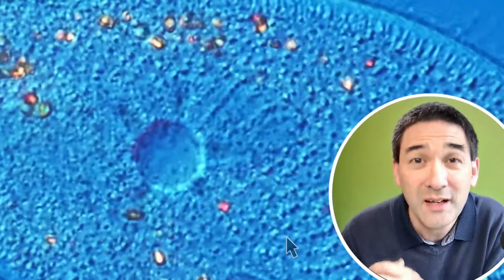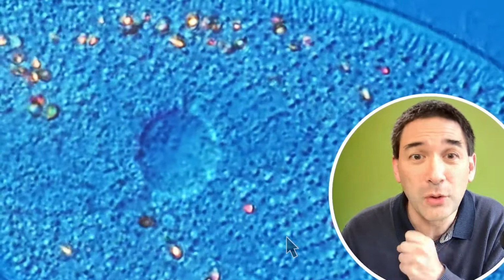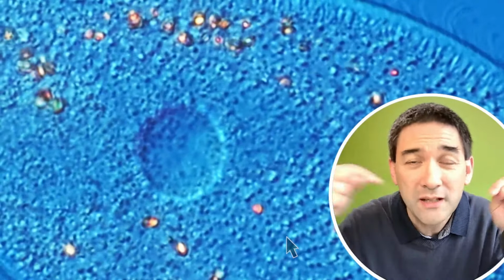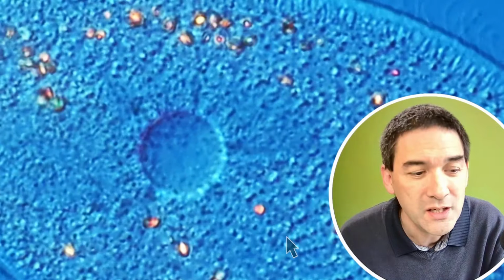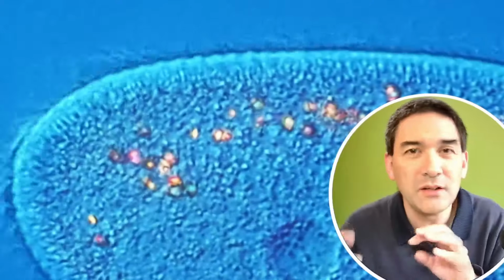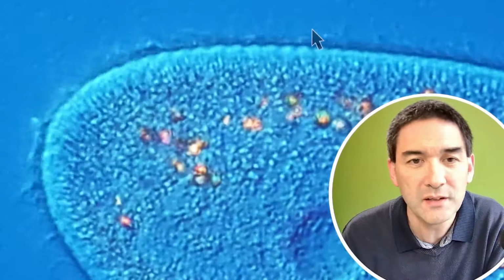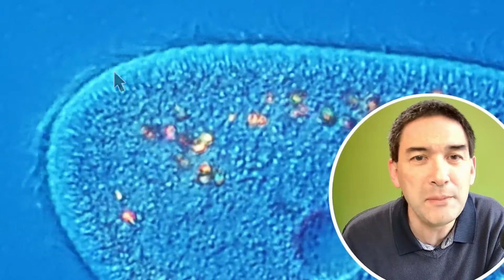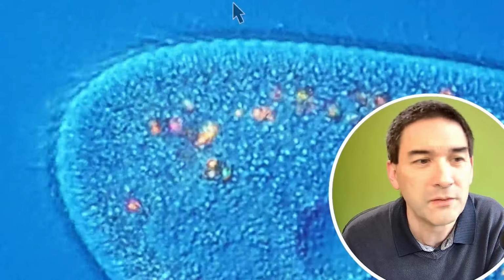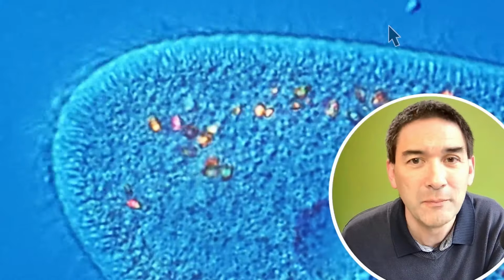And this is basically the way the paramecium protects itself from bursting, because on the surface of the cell, there's the cell membrane, and water is always going into the cell by osmosis. So I would like to also show you now the surface of the cell itself. Okay, you see that there are these tiny hairs moving here. These are called cilia on the surface. And those cilia constantly beat. You can see that there are also some bacteria and some other organisms floating around here very fast. This is not time lapse. This is real, in real time.